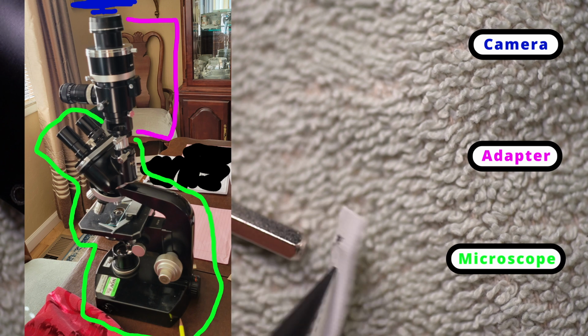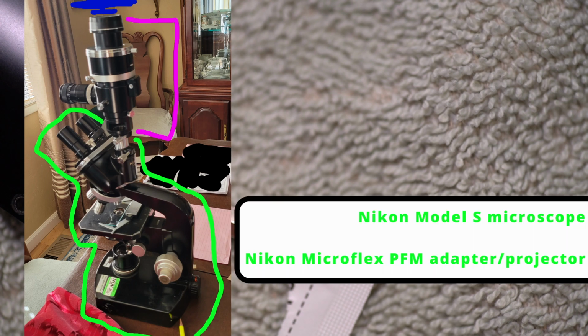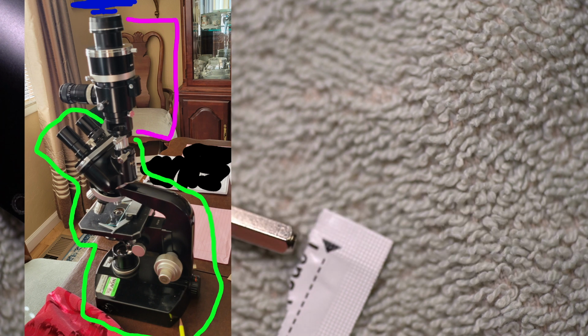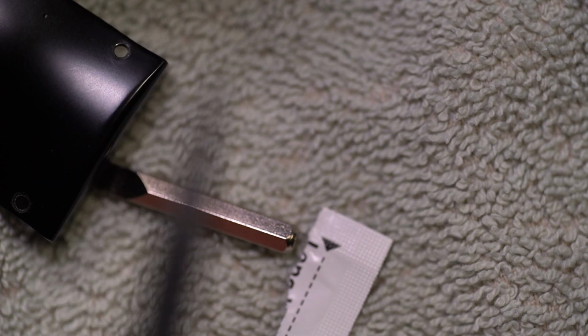Now what you want to do with film photography, and this is when this microscope was made, in the 60s or 70s, you had film cameras, and the shutter in those, especially from that era, was fairly heavy, and it actuates linearly, so the entire shutter goes chunk chunk, and it goes out of the way, and then it goes chunk chunk back in a line.